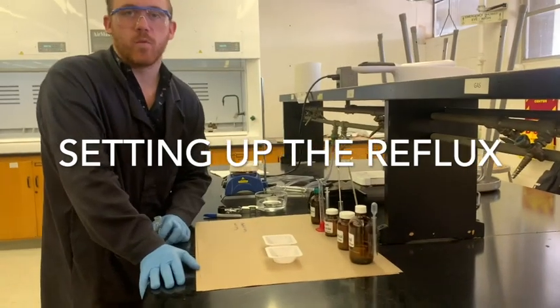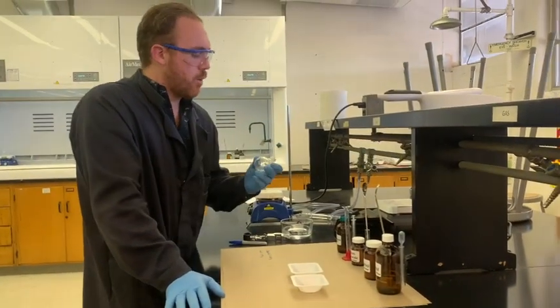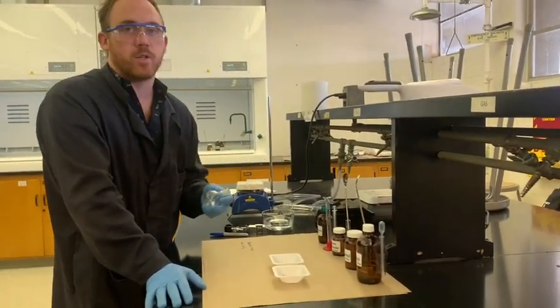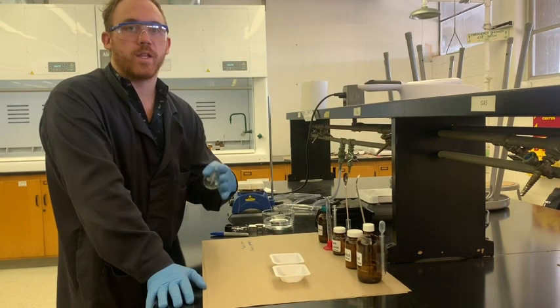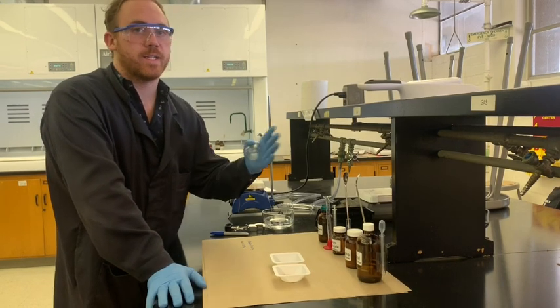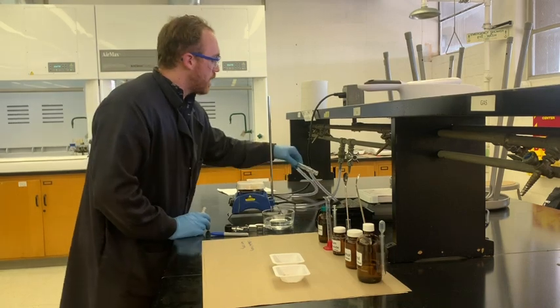So what we're doing today is the Williamson ether synthesis. We're going to start a reflux, which is essentially boiling the solvent and allowing it to condense in a condenser, which we have set up here.